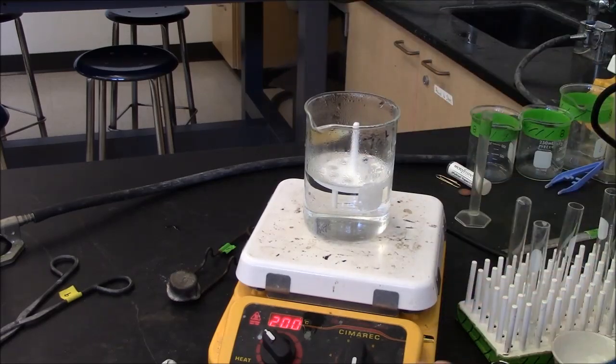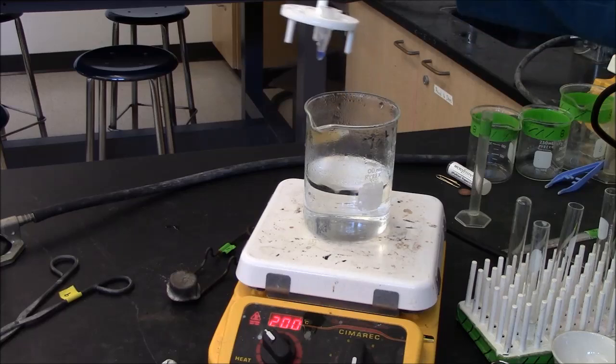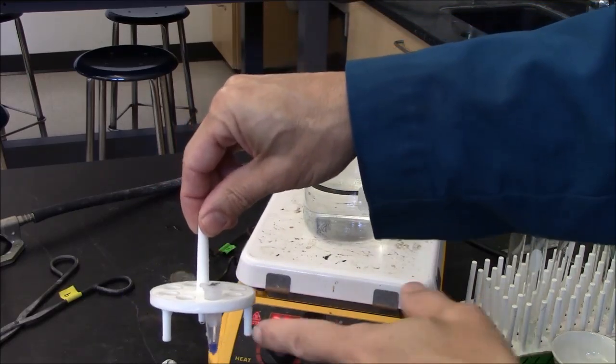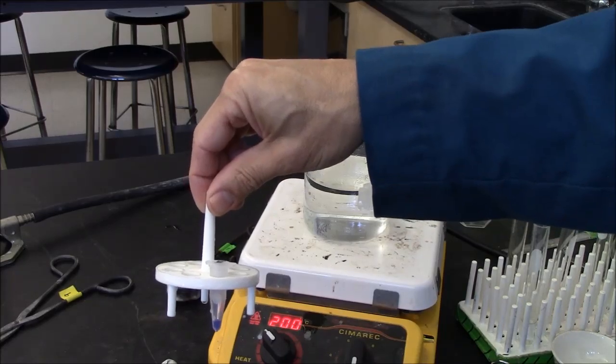Now I'm removing the tube from the hot water. It's been 5 minutes and I'll keep this in the refrigerator until I'm ready to load it.